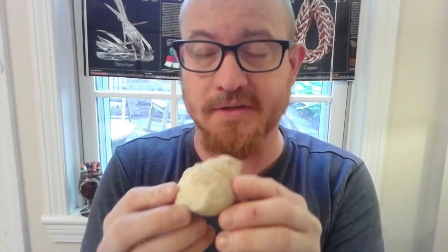What we're going to do right now is a quick and simple demonstration of something you are familiar with: what happens if you put in acid to test whether or not this actually is limestone. It's one of the lessons Miss Fiddler gave you last year when you were testing different types of minerals and rocks for reactivity. And this is one of them. Let's take a closer look.